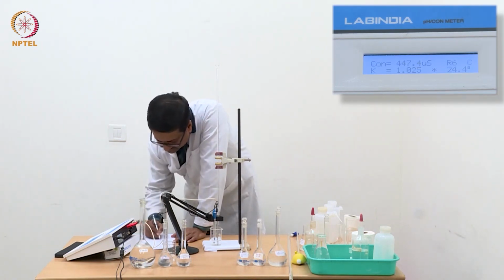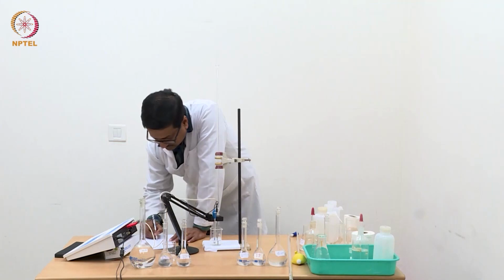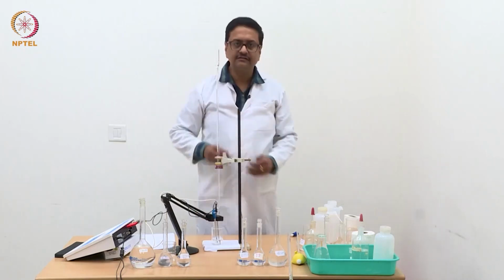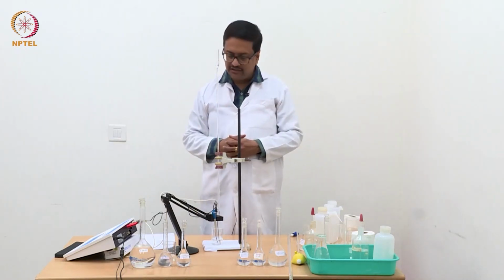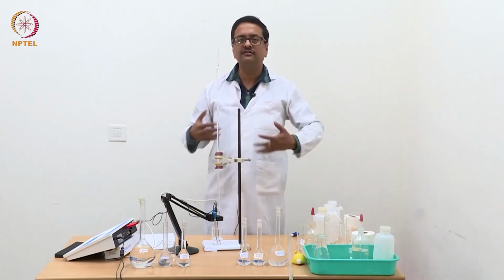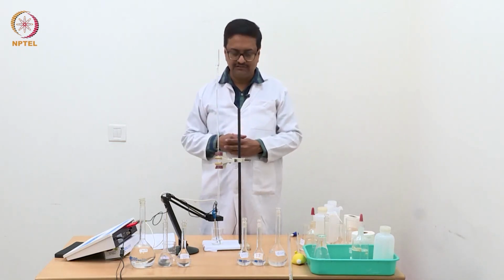So now the reading is 447. This is an indication of slight increase, and with more, I think it may start to show increasing trend, because if ammonium chloride that was present in the solution is almost consumed or is completely consumed, it will start to increase.